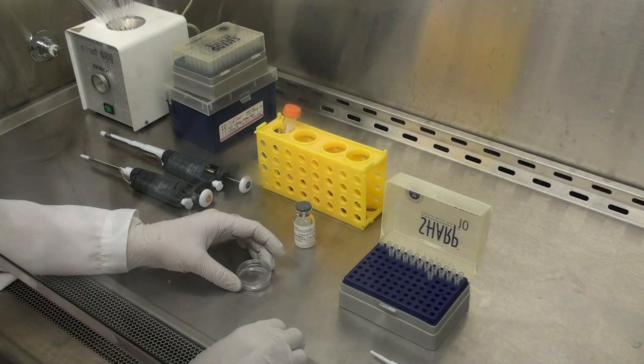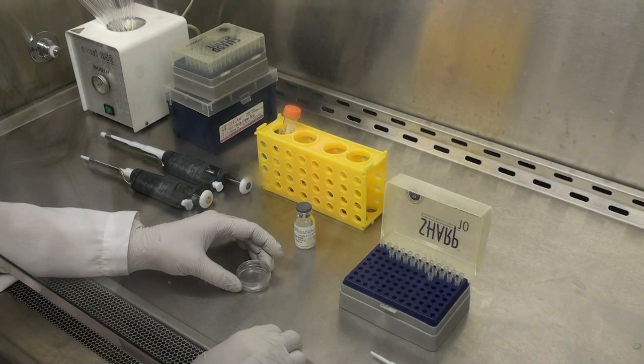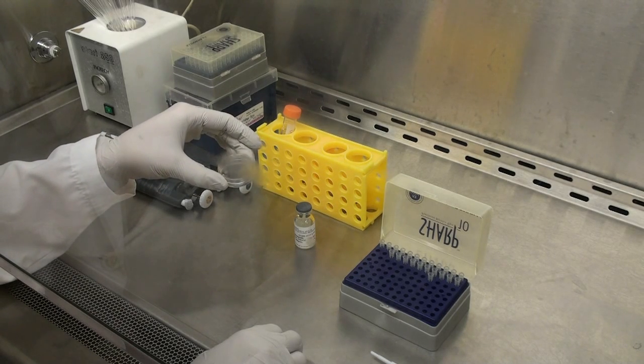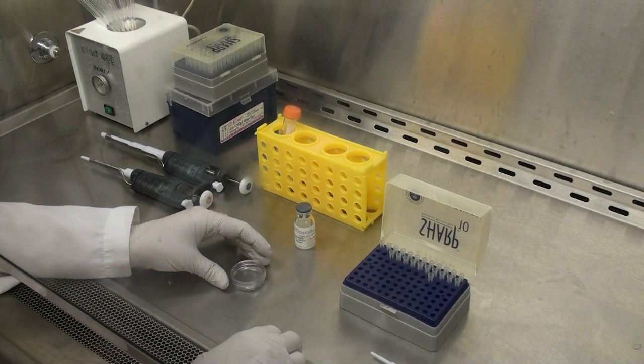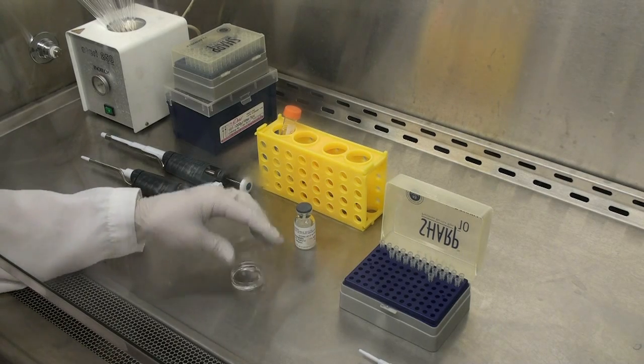Before plating cells on the gel surface, we need to first conjugate fibronectin on the gel surface. In order to do this, we need to first activate the gel surface with hydrazine hydrate solution. We have already activated the gel surface with hydrazine hydrate. We then wash the gel with acetic acid solution and twice using PBS. Now we are ready to plate fibronectin on the gel.